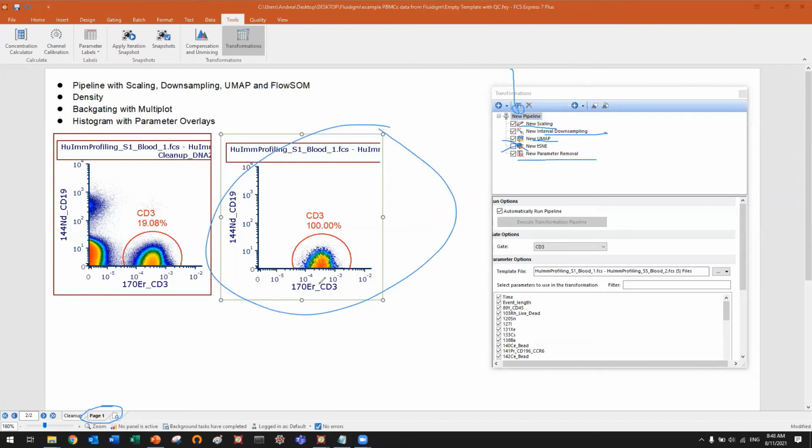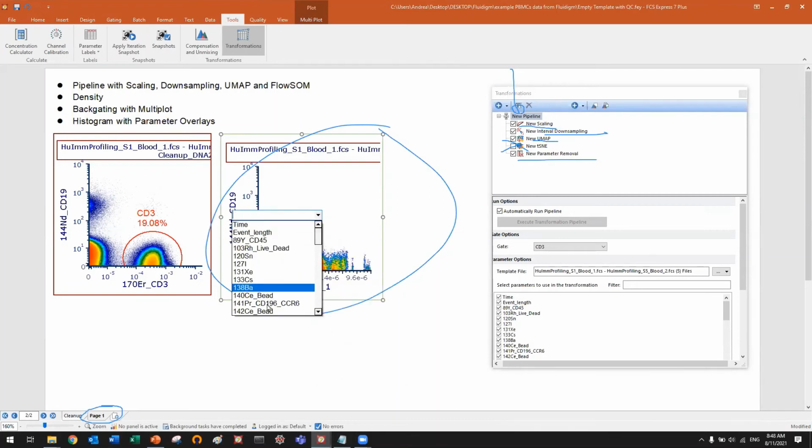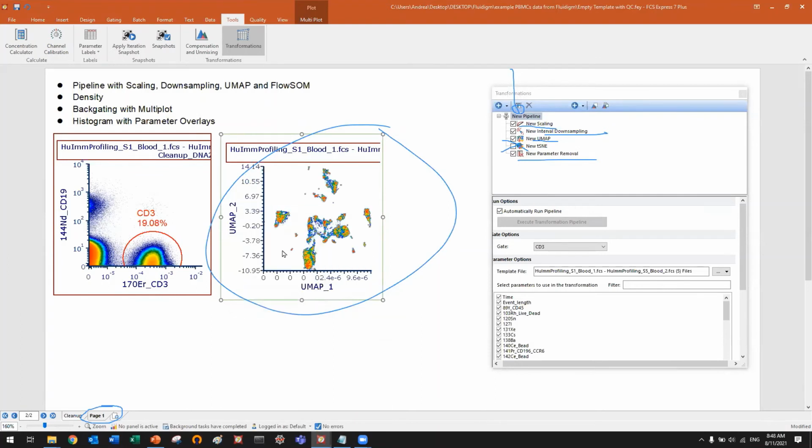So now in this plot, I can access UMAP 1 and 2 at the bottom. I no longer see the scaled data because I used the parameter removal. So this is my UMAP. If you want, you can also, let me go back here, I think I have like 2 minutes left.